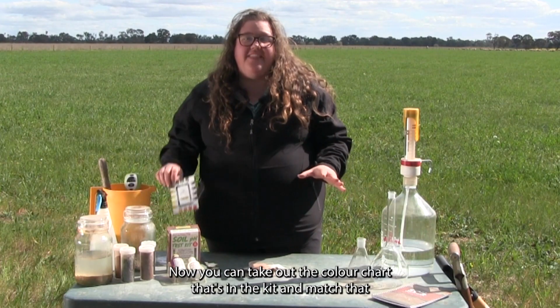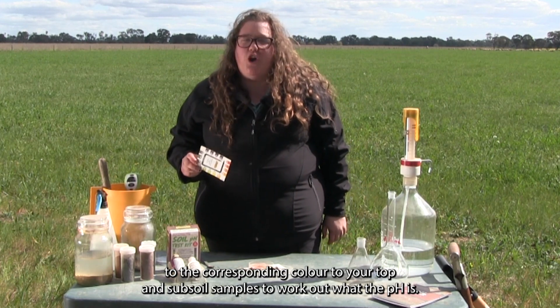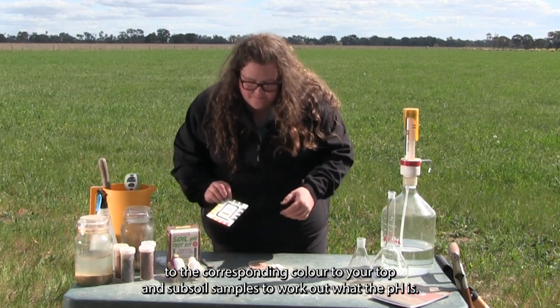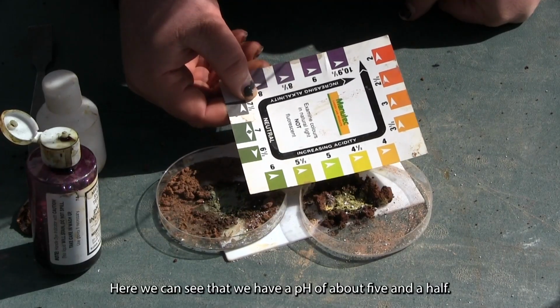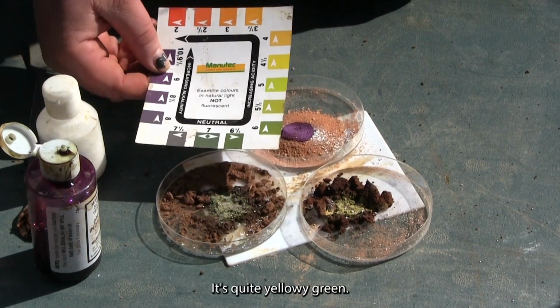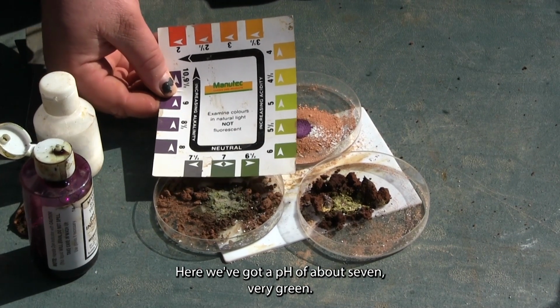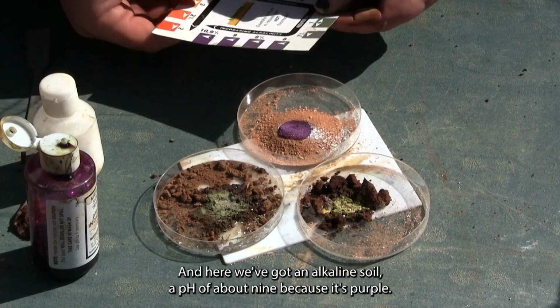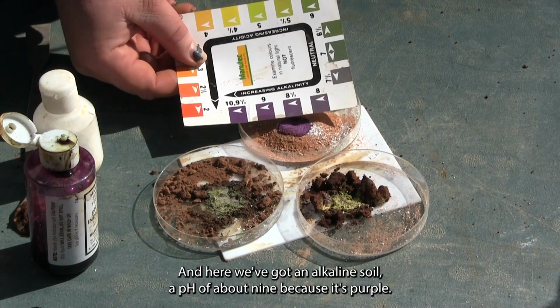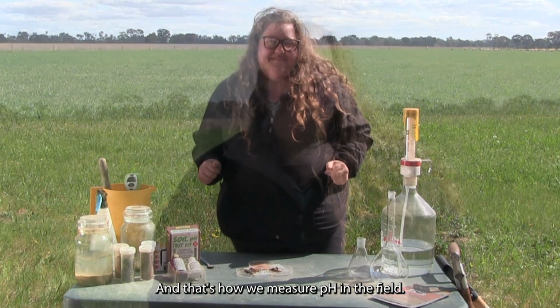Now, you can take out the colour chart that's in the kit and match that to the corresponding colour to your top and subsoil samples to work out what the pH is. Here we can see that we have a pH of about 5.5. It's quite yellowy green. Here we've got a pH of about 7, very green, and here we've got an alkaline soil, a pH of about 9 because it's purple. And that's how we measure pH in the field.